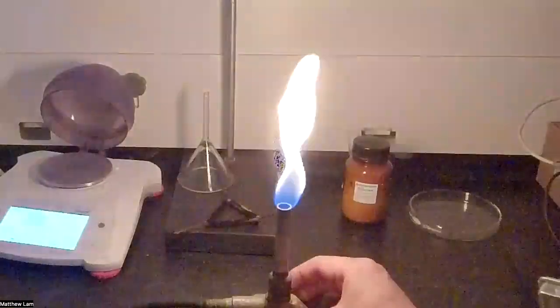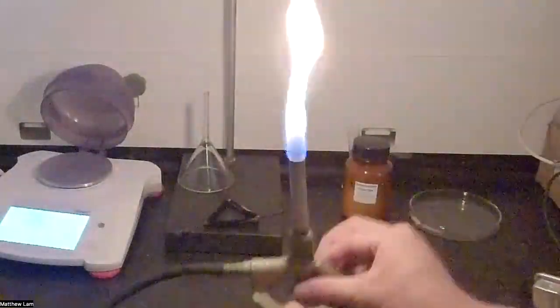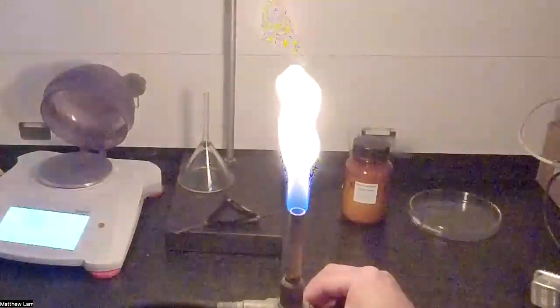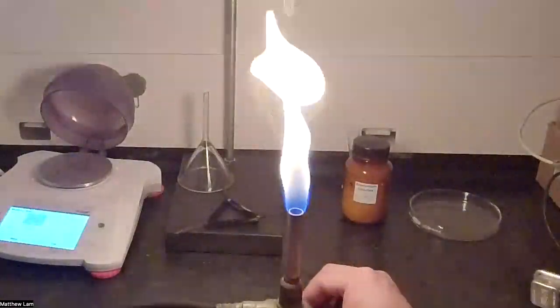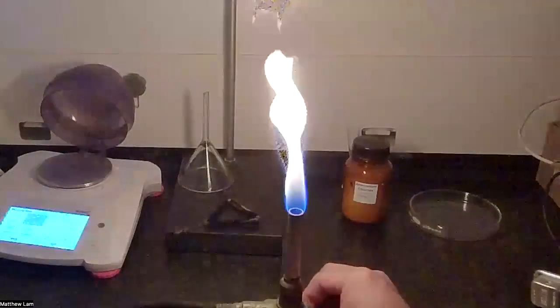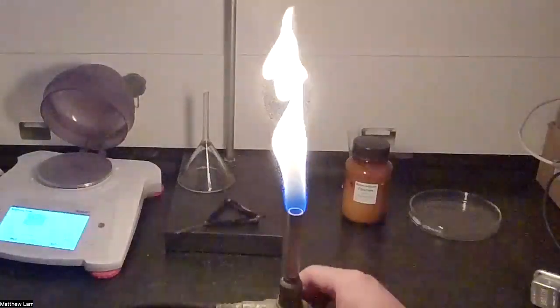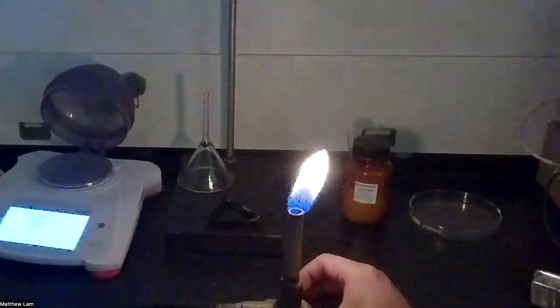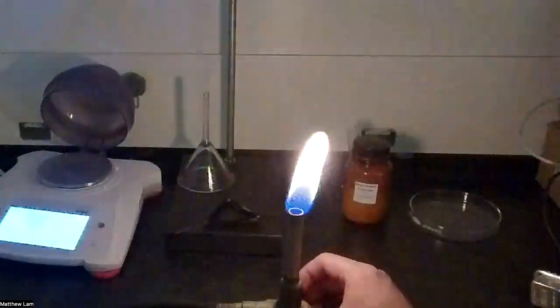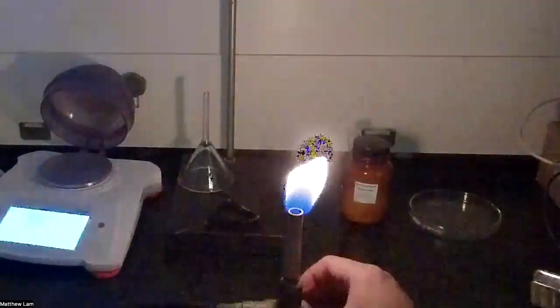So here on the bottom, if I twist the bottom, you can put more gas or less gas. As you can see, there's a bigger fire, and as I twist this down, the fire decreases. So let's keep it at that for right now.